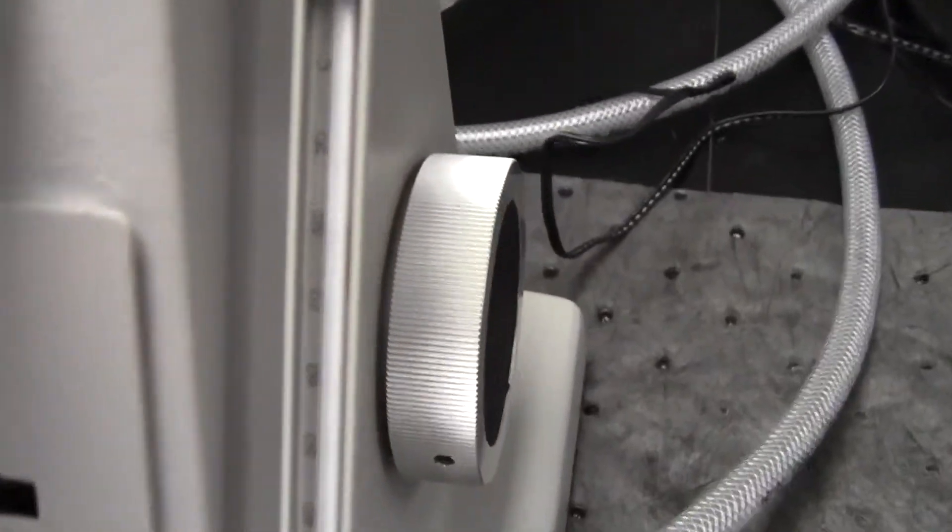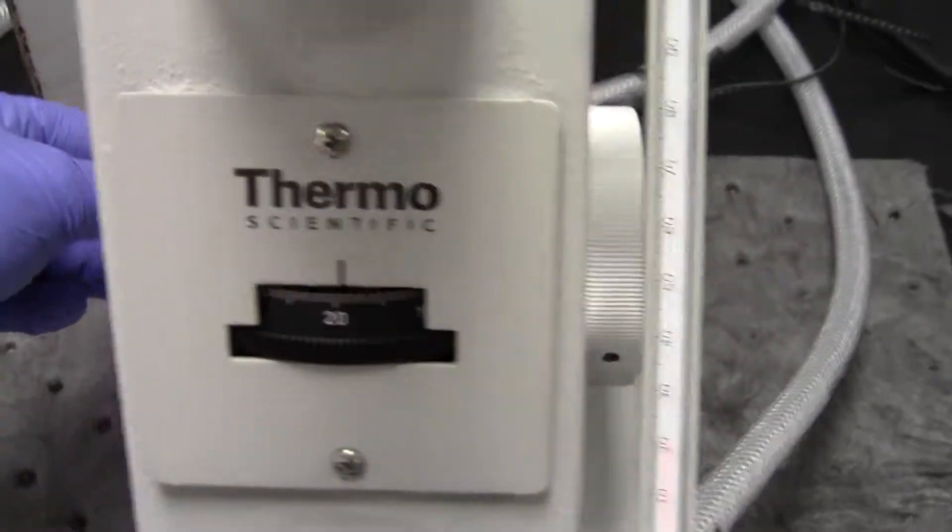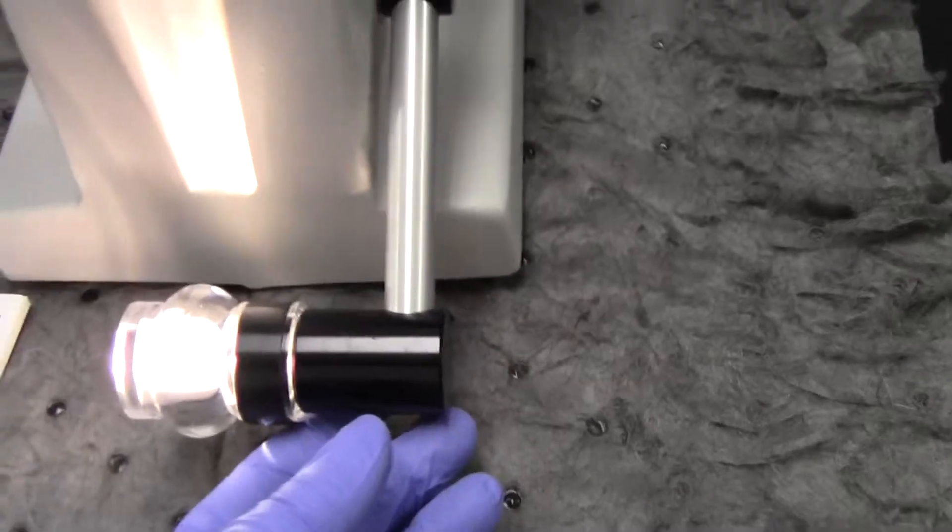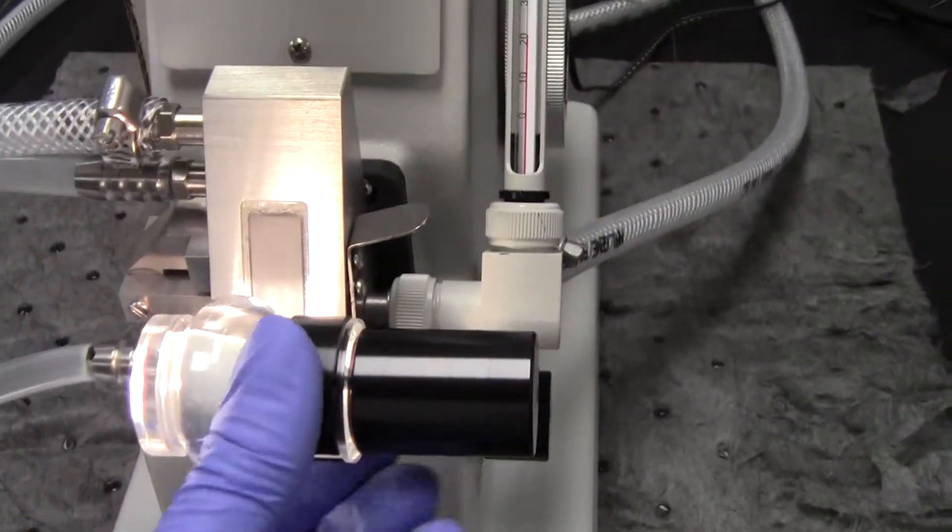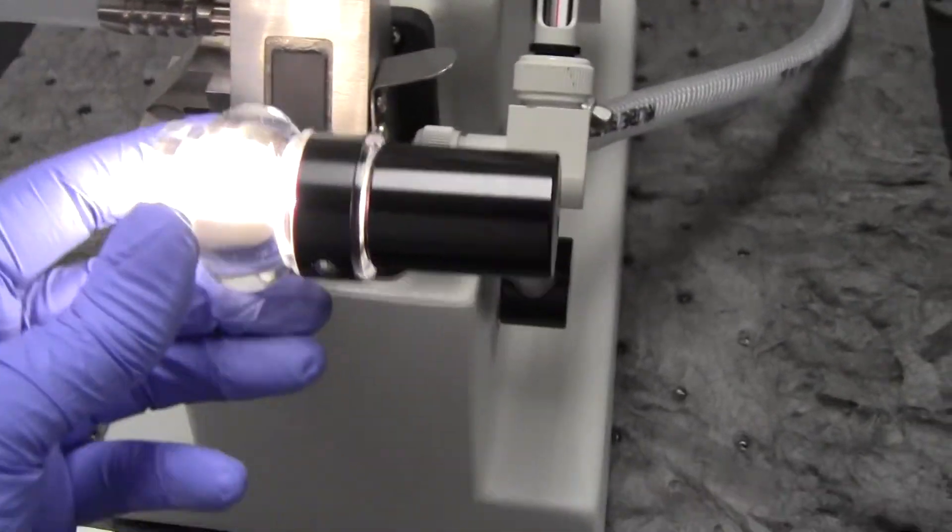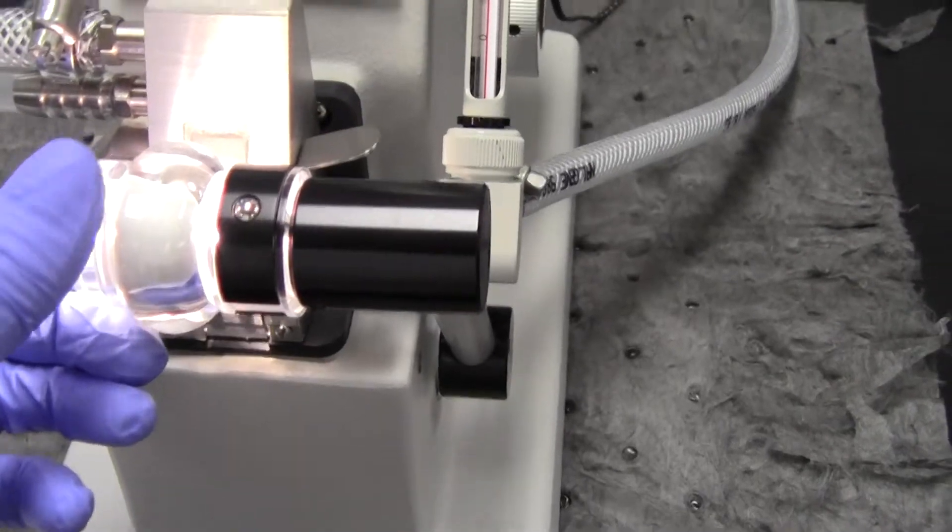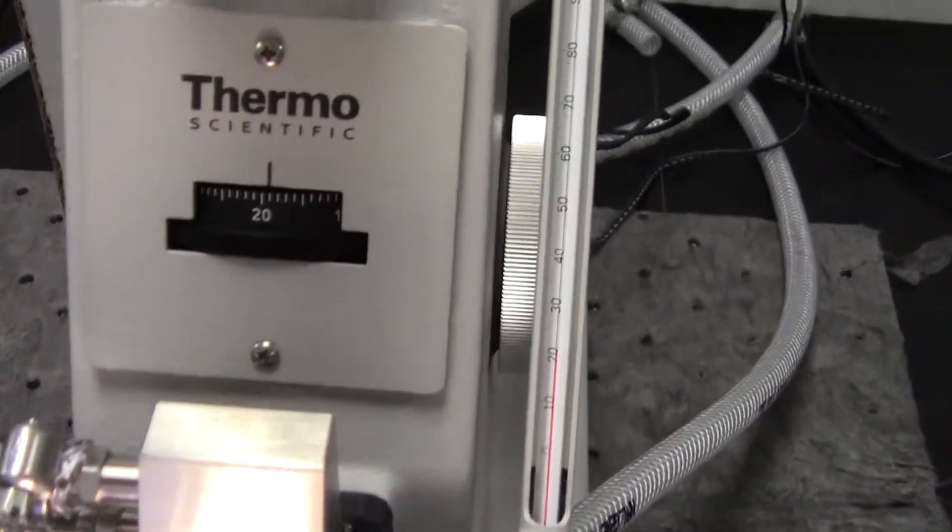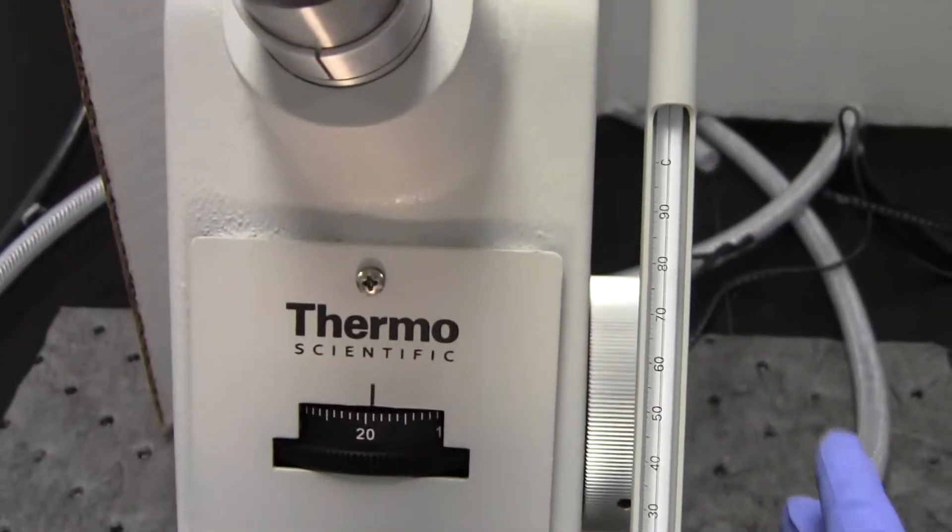There's a little switch here to actually turn on the light, and we'll direct the light right through the prism. Then we'll look inside.